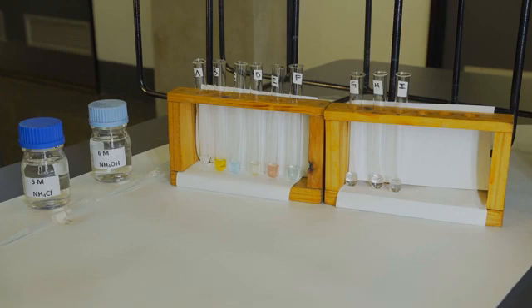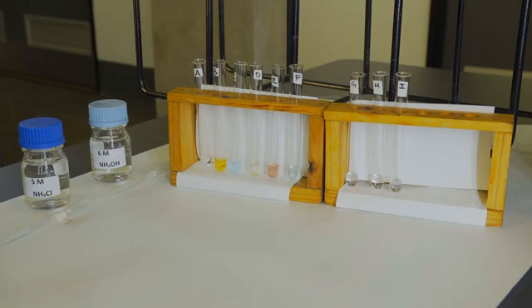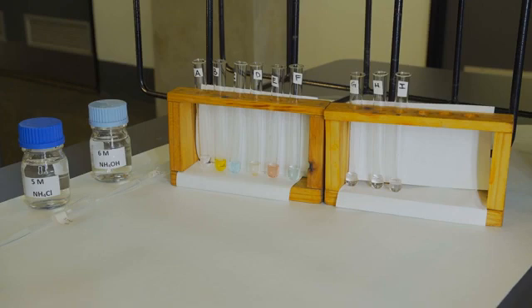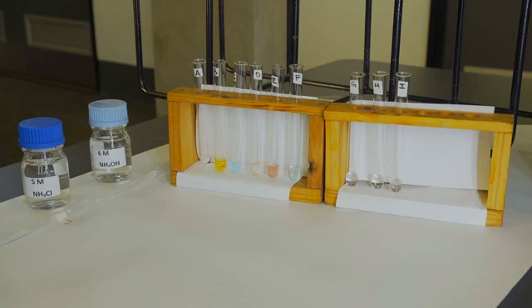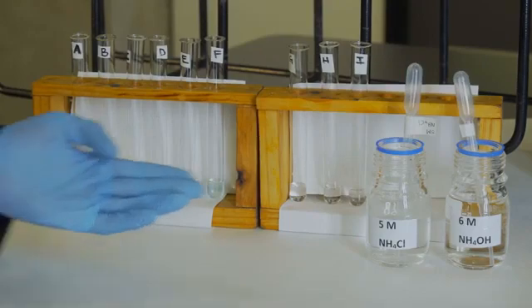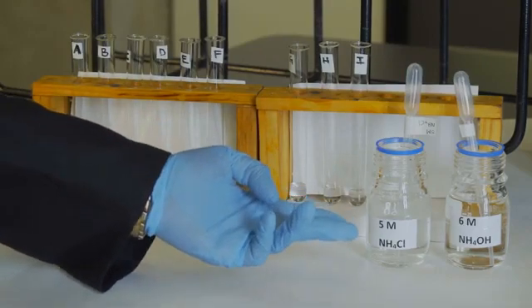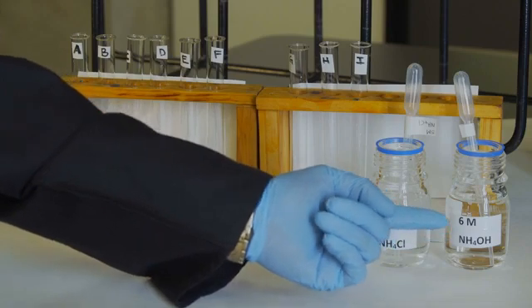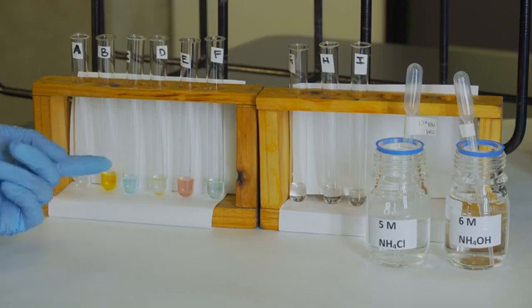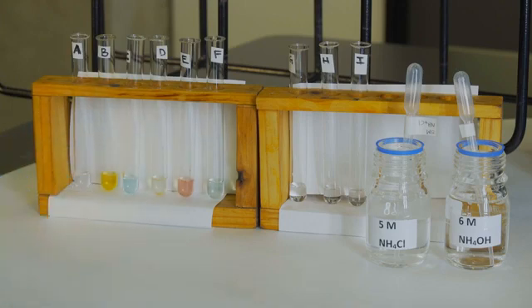Before beginning, record your initial observations. The observed reactions consist of color changes and precipitates forming in the solution on addition of ammonium chloride and ammonium hydroxide solution. These changes indicate the presence or absence of the desired cation. Here we have our unknown solutions, and to these we shall add 3 drops of ammonium chloride and 5 drops of ammonium hydroxide.